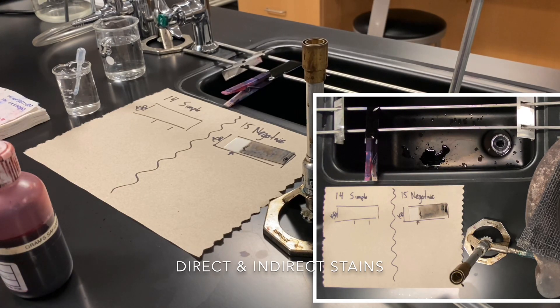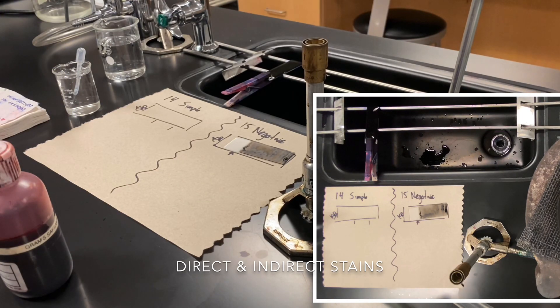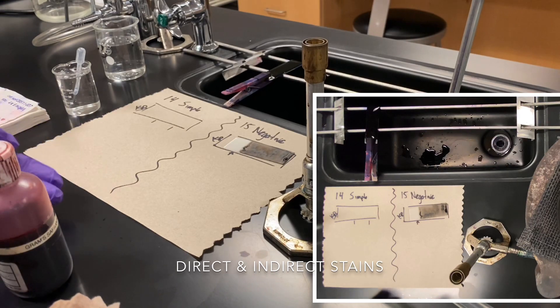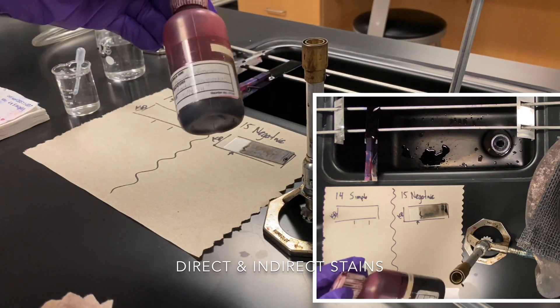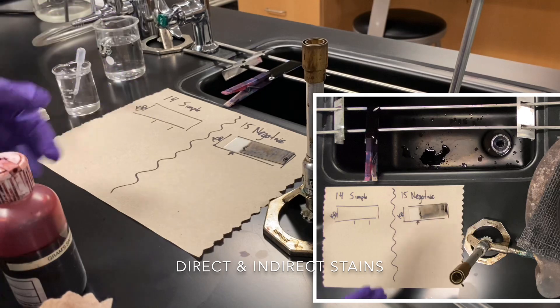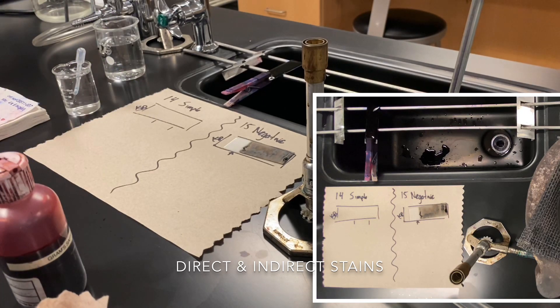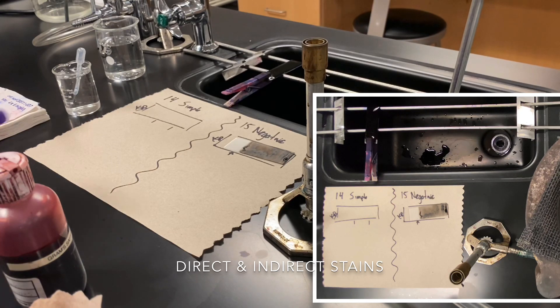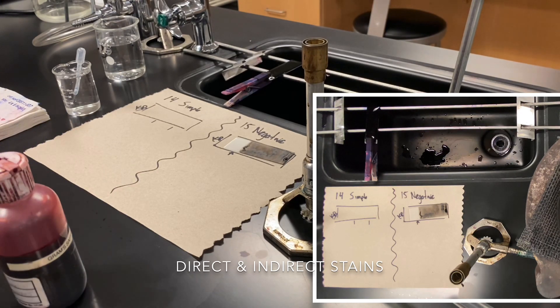Once the methylene blue minute is done, we'll rinse it out and the simple stain will be complete. For the negative stain, on the other hand, we're not going to rinse it — instead, we're going to apply safranin directly to it as well, let it sit for 30 seconds to a minute, then quickly rinse it out with water. Then we'll observe both slides under oil immersion.